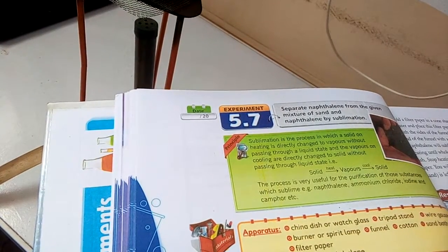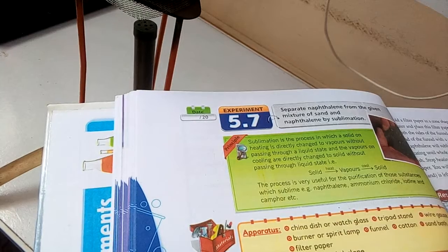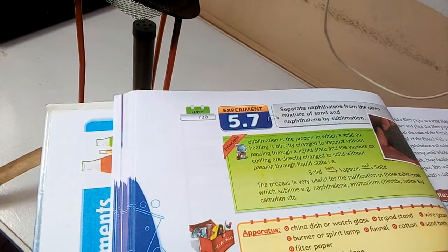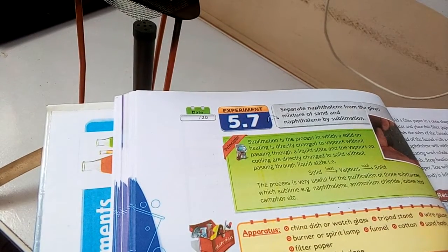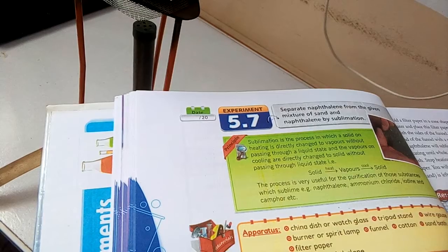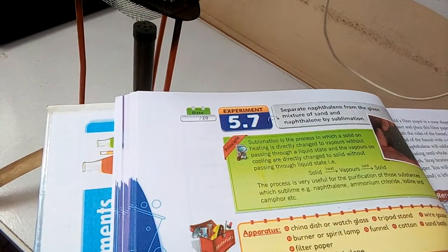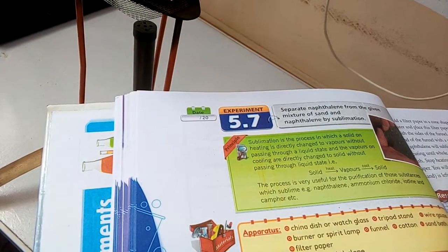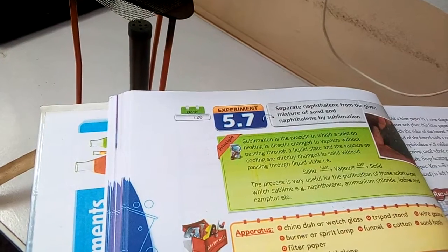Separation of the given mixture is based upon the difference in the physical properties of the component substances. The mixture of naphthalene and sand is separated using the property of naphthalene to undergo sublimation on gentle heating. The materials required for the experiment can be seen in the list.